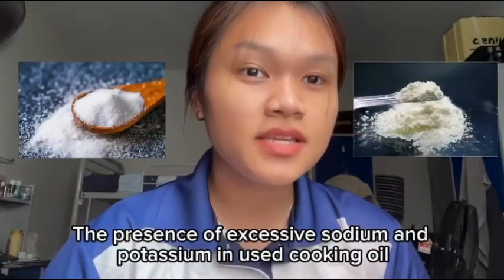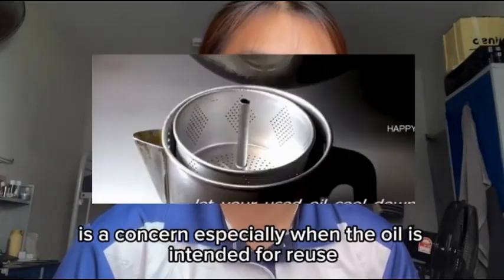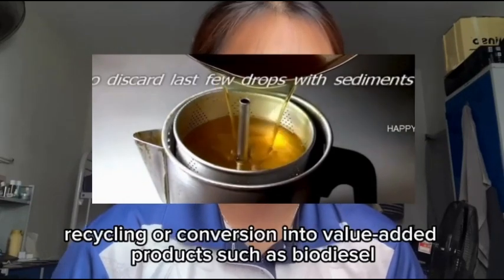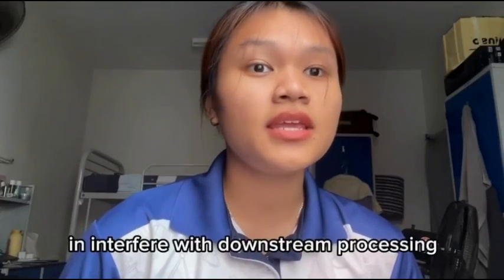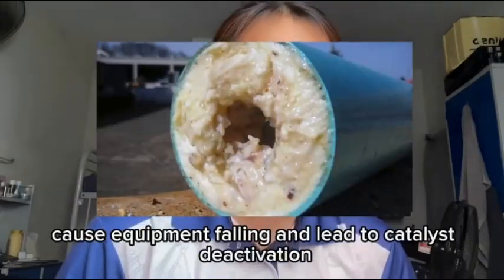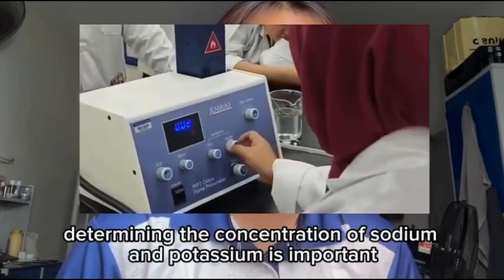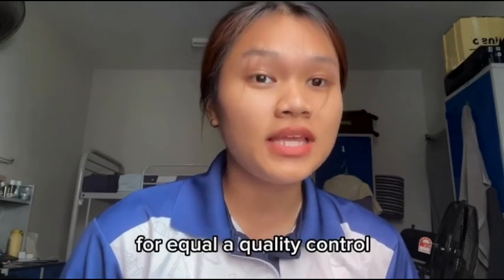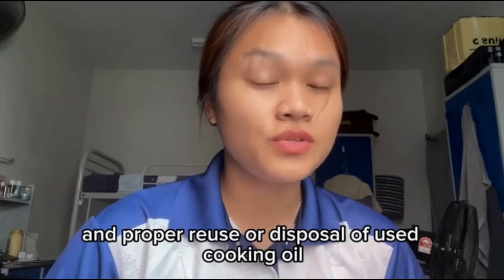The presence of excessive sodium and potassium in used cooking oil is a concern, especially when the oil is intended for reuse, recycling, or conversion into value-added products such as biodiesel. High levels of these metals can interfere with downstream processing, cause equipment fouling, and lead to catalyst deactivation. Therefore, determining the concentration of sodium and potassium is important for quality control, environmental assessment, and proper reuse or disposal of used cooking oil.